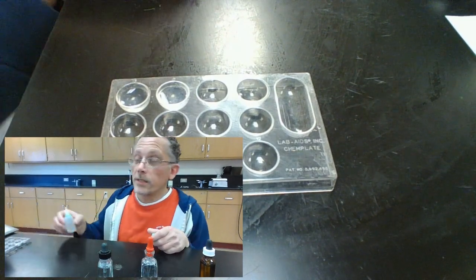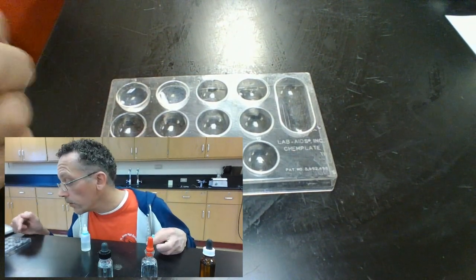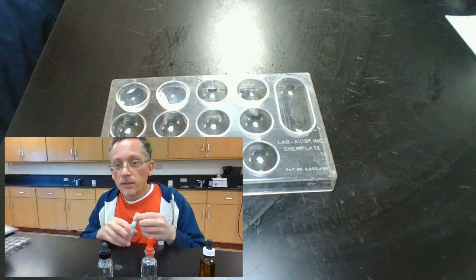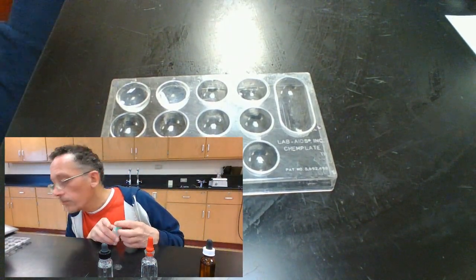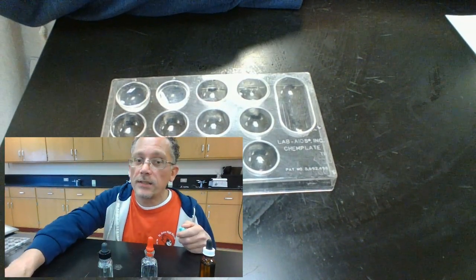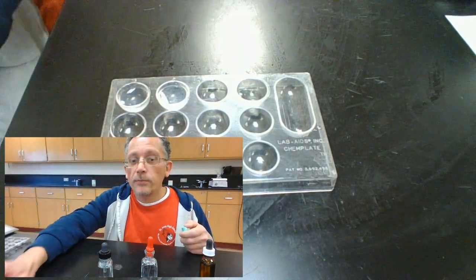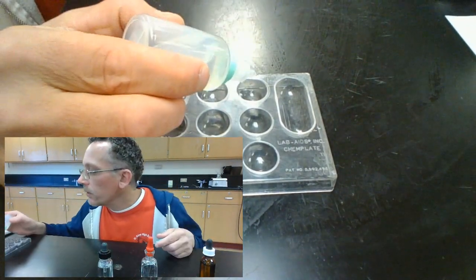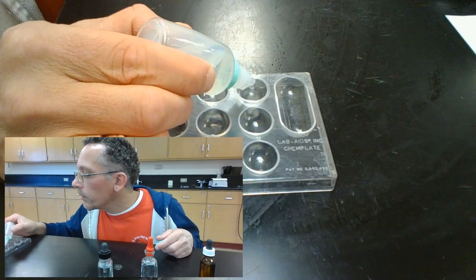Yeah, this one's hard to see. It looks like in my zinc compound, some of that precipitate has gone away, and the calcium compound, it has not. So that's what we expected from our tests. Let's do the unknown and see which one it behaves like. So I'm going to put some in the unknown here.